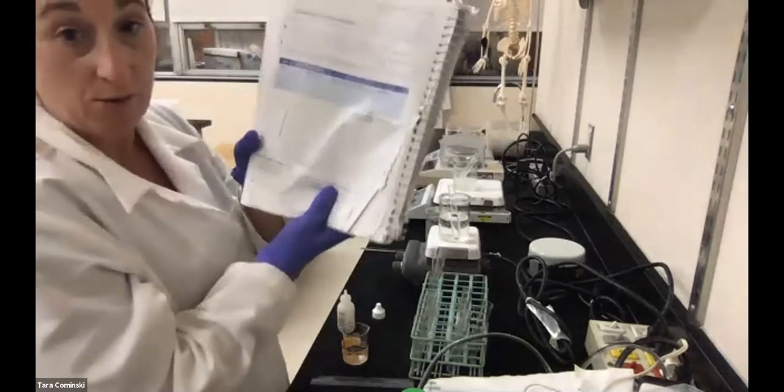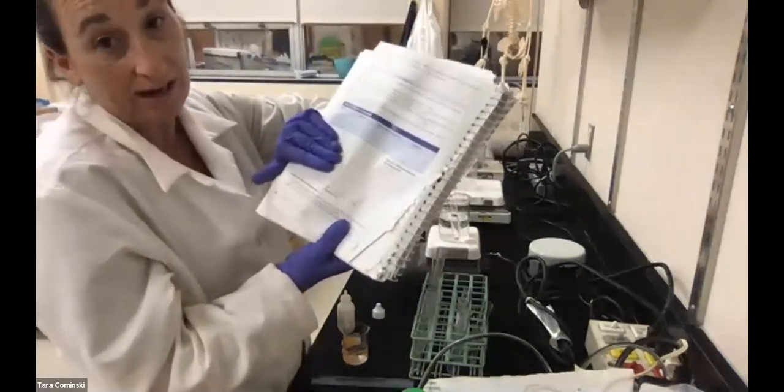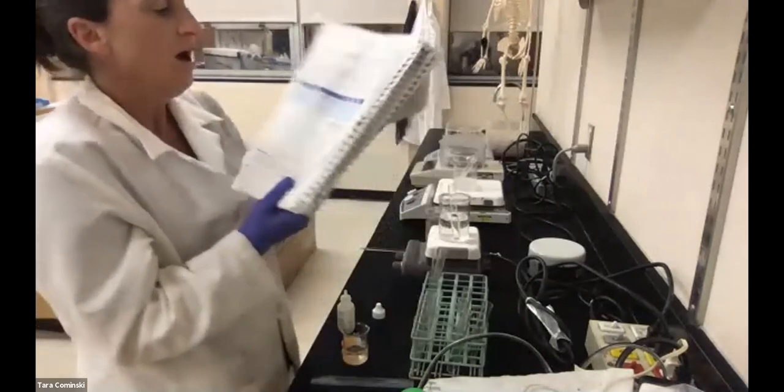All right, so again, you're going to be completing this table, writing it up in your Word document, and you're also going to have a graph to make here. All right, so let's see what we got.